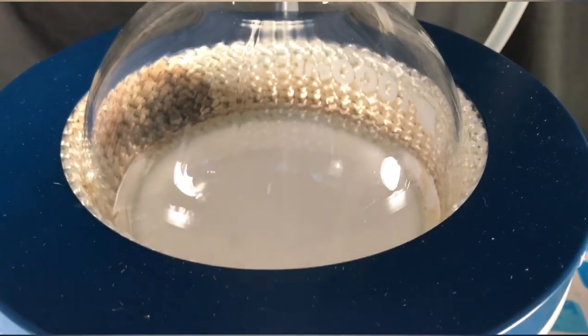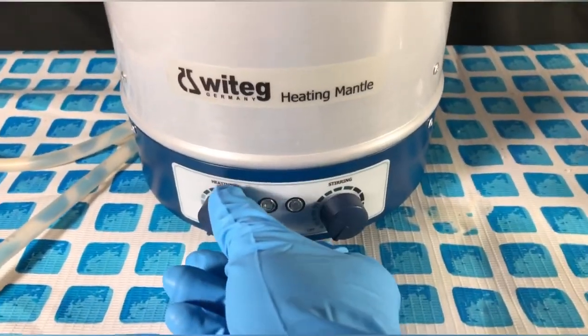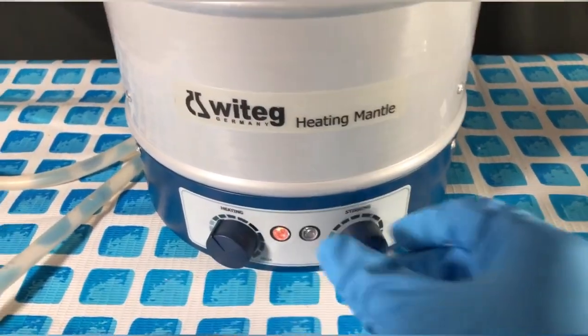This is what the mixture looked like. To get the reaction going, heating and stirring of the heating mantle were turned on.